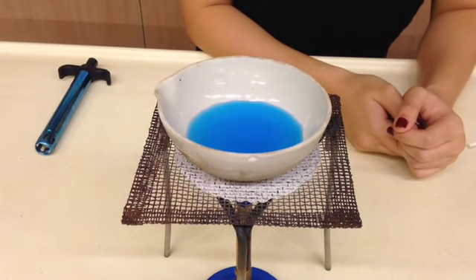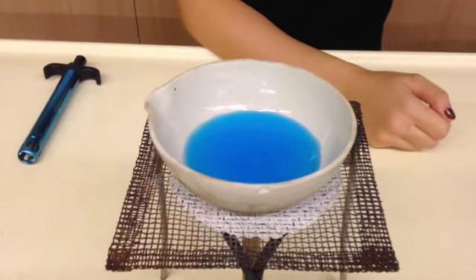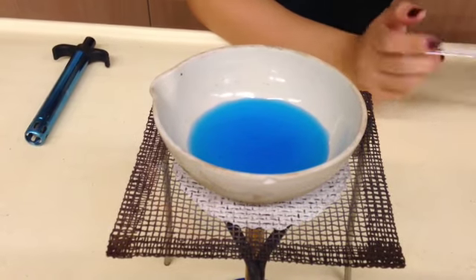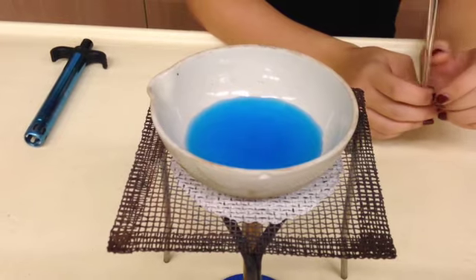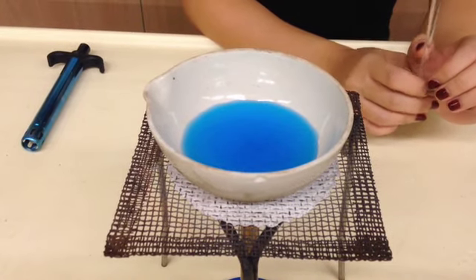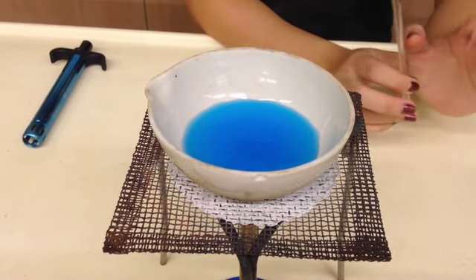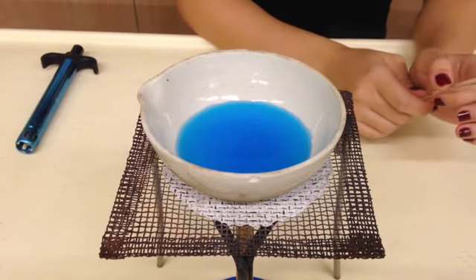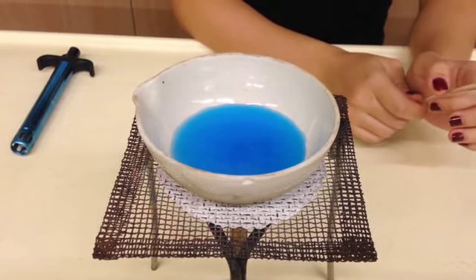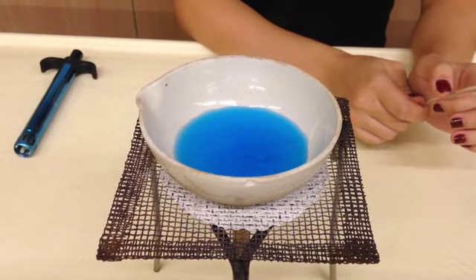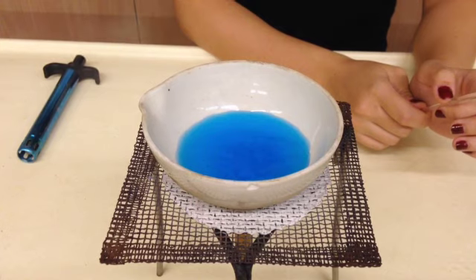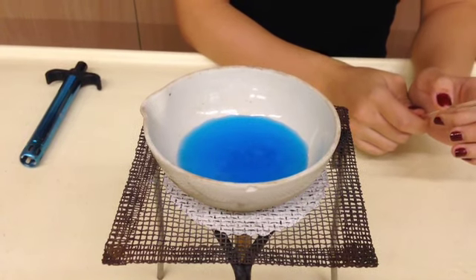Take note that your bubbling should not be too vigorous. It should not be a very quick boiling away of water. During this time also, as far as possible, try to refrain from touching your evaporating dish or moving it, because this can also affect the crystallization process. If your boiling is too vigorous, you should turn down the flame a bit.